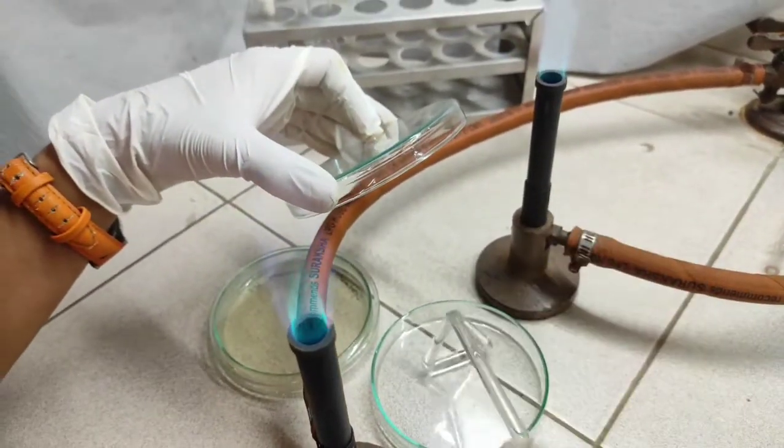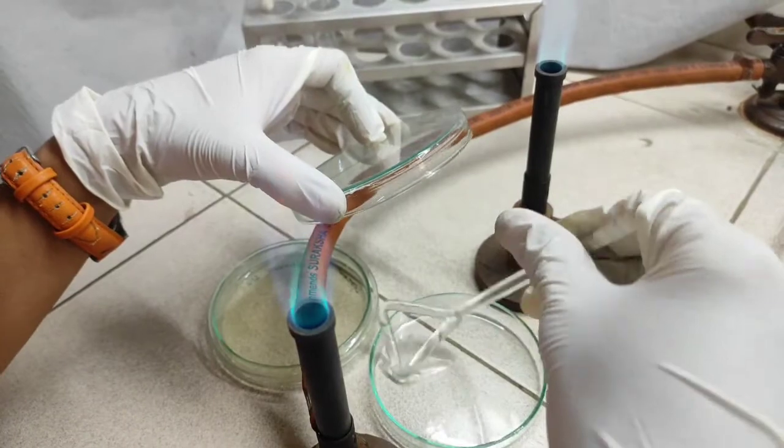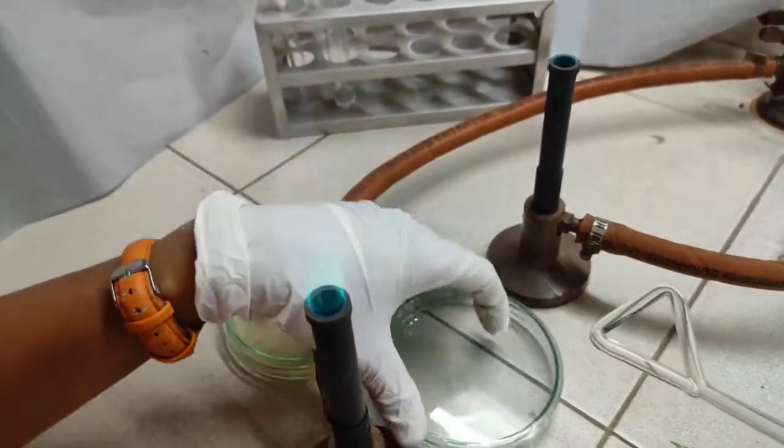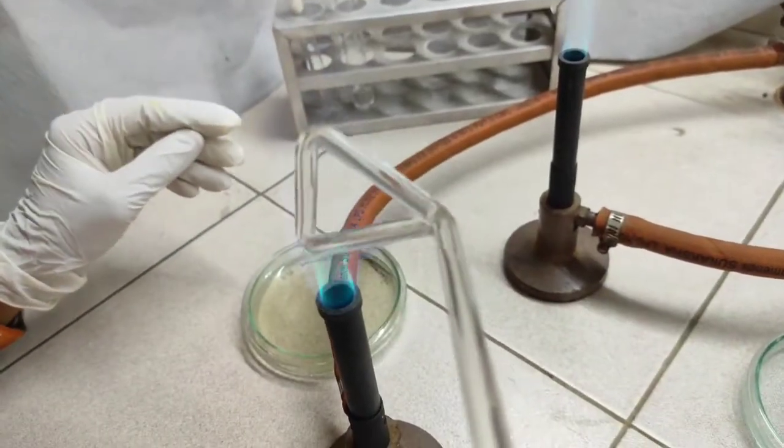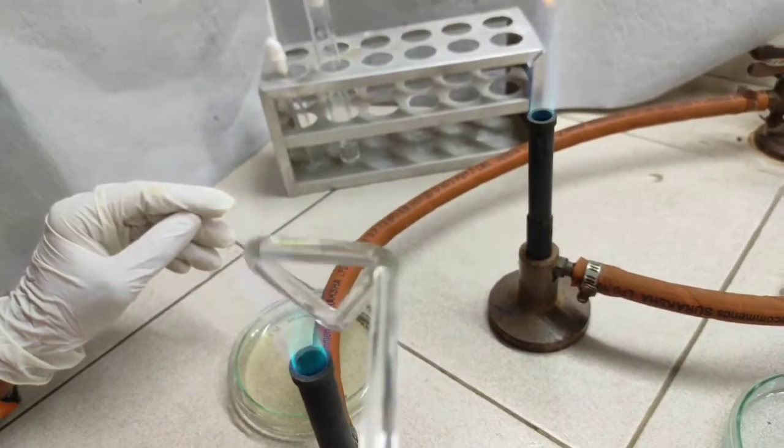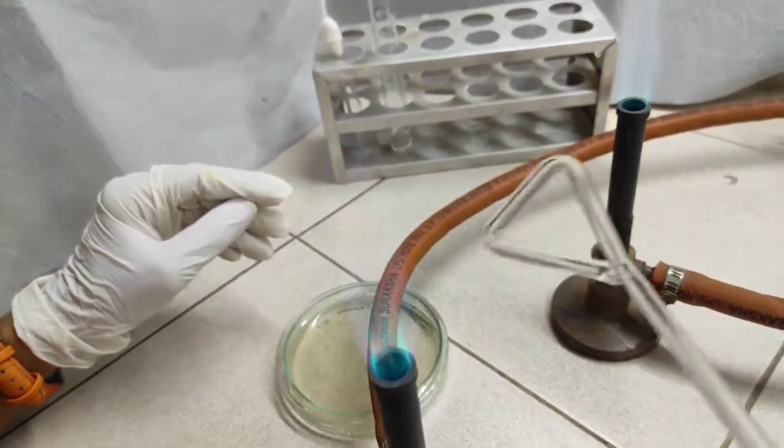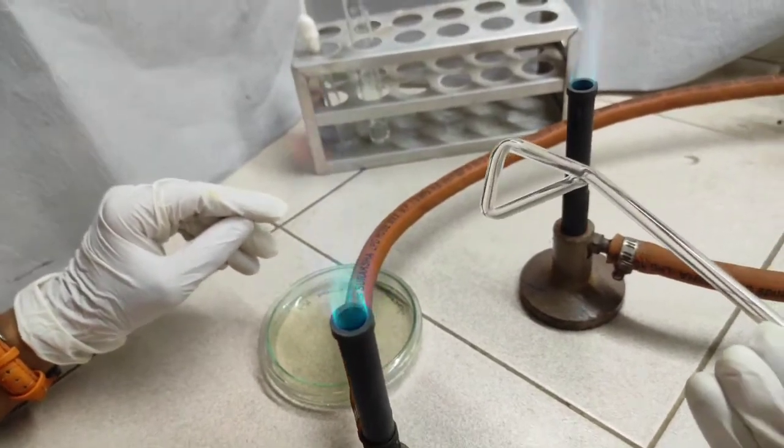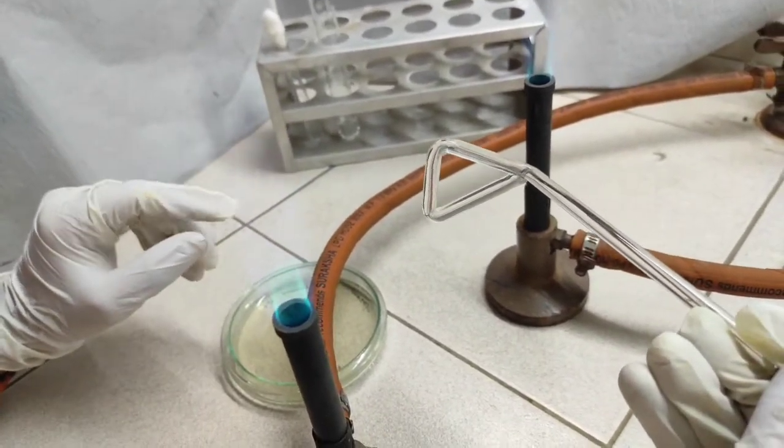We have to sterilize it first using the alcohol. Just flame like this. Allow it to cool.